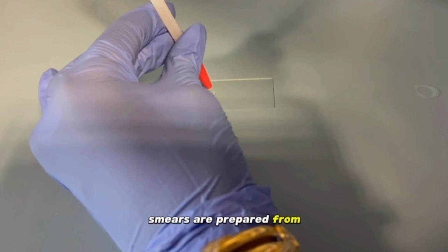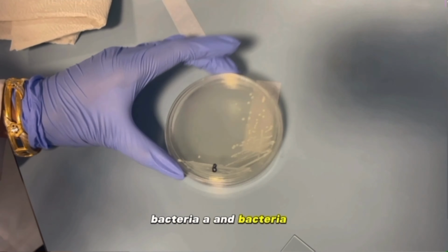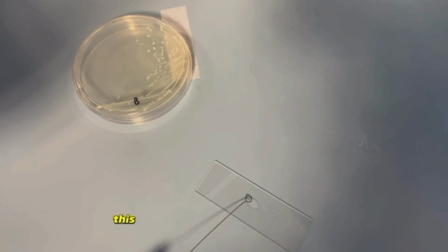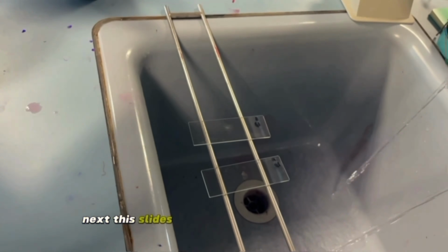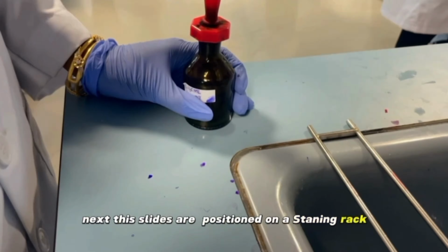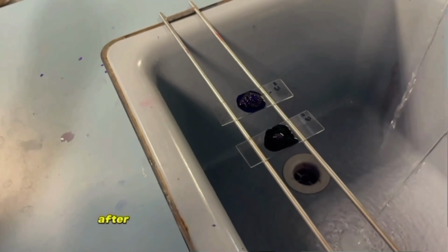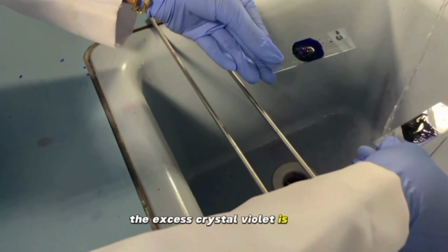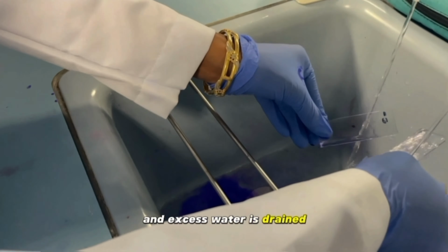Smears are prepared from cultures of two distinct microorganisms, bacteria A and bacteria B, representing each of the two groups. These smears are air dried and heat fixed. Next, the slides are positioned on a staining rack and each smear is inundated with crystal violet. After allowing the stain to set for 1 minute, the excess crystal violet is rinsed off the slide using tap water and excess water is drained.